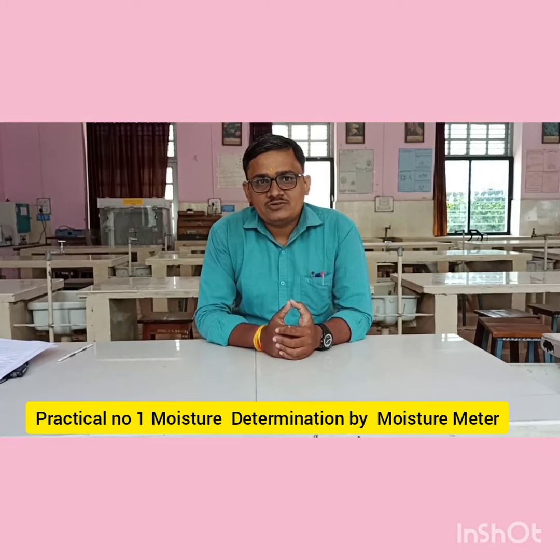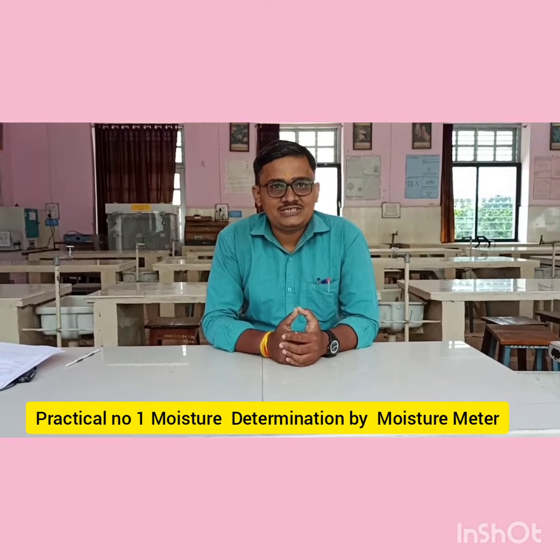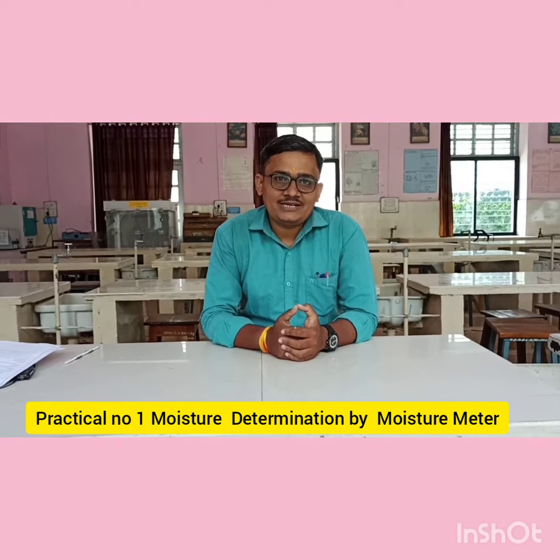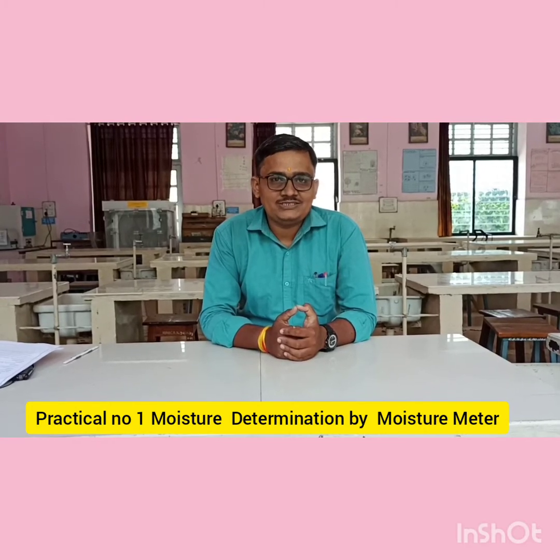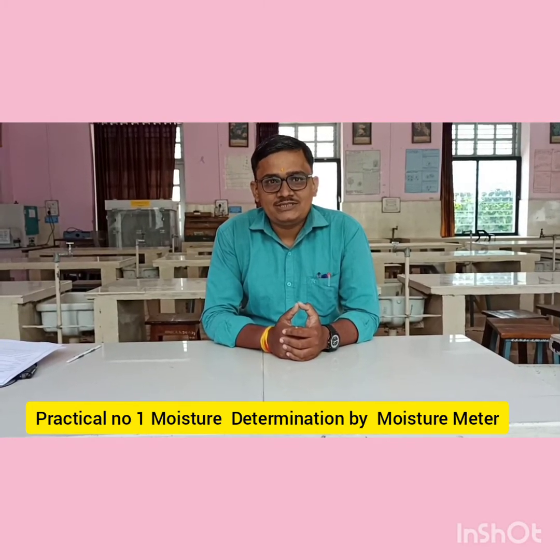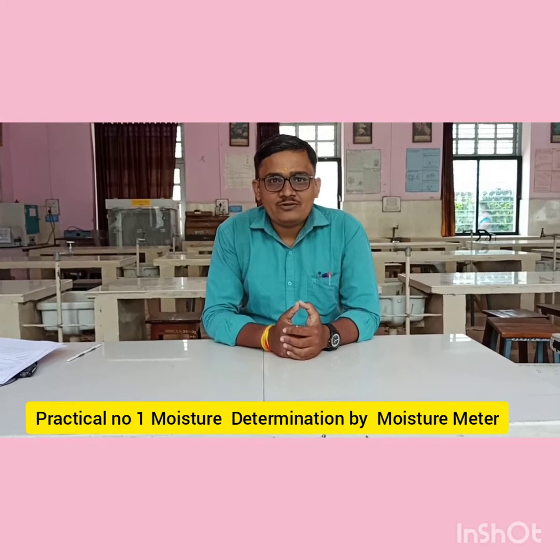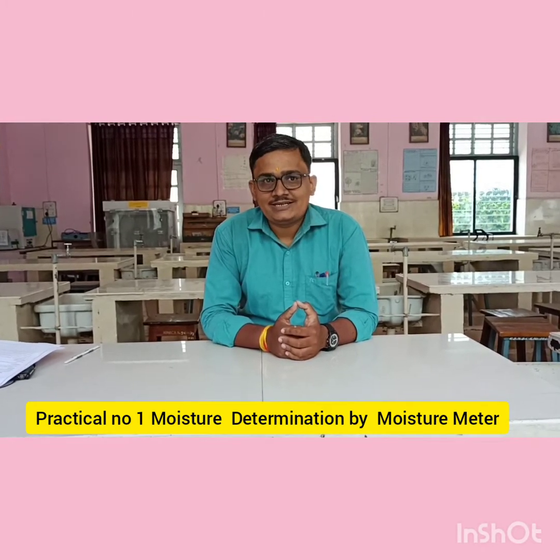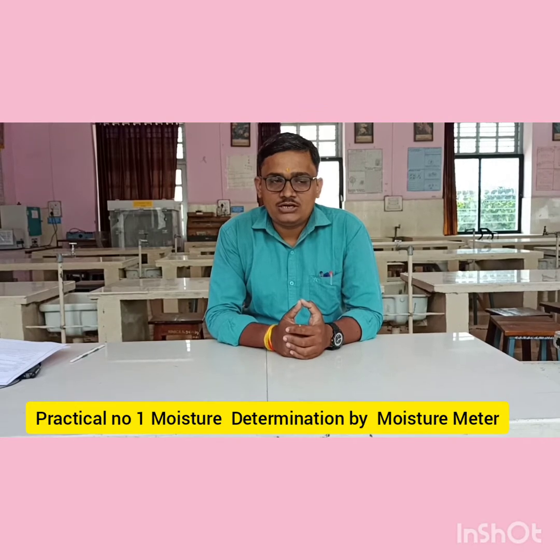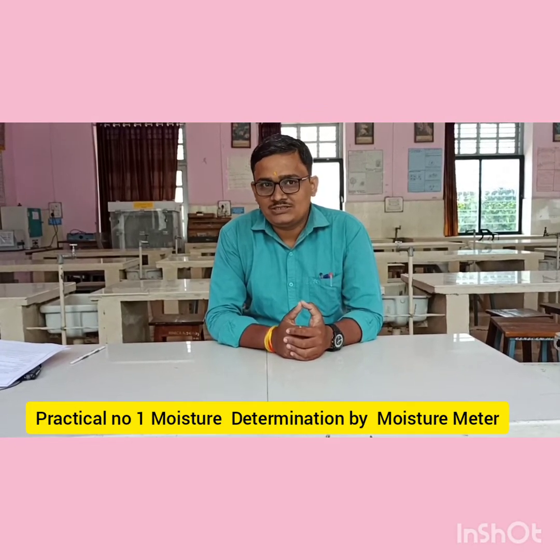First we are going to see what is moisture. Moisture is nothing but the water content present in a seed — that is known as the moisture of a seed. The principle of this practical uses two instruments: the first is the digital moisture meter and the second is the oven method.